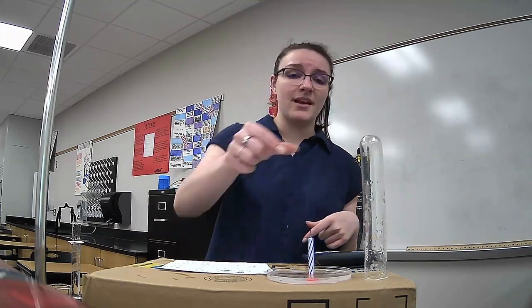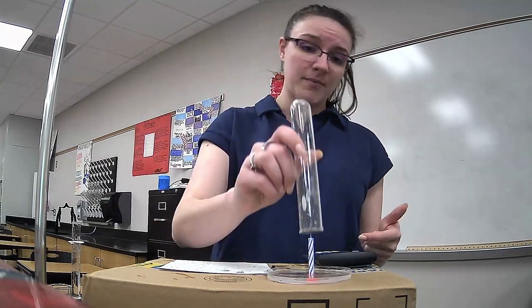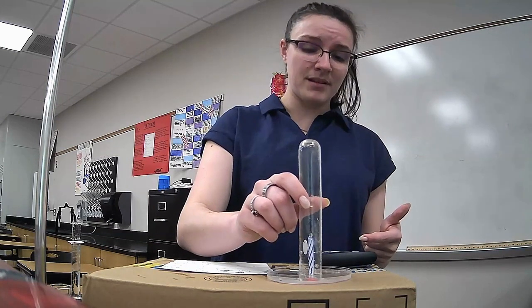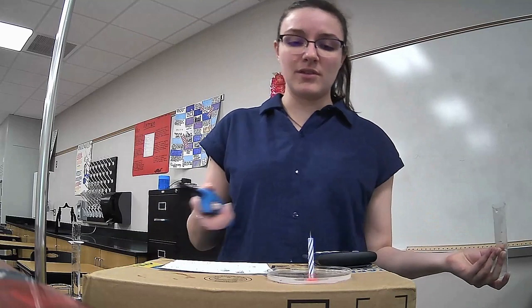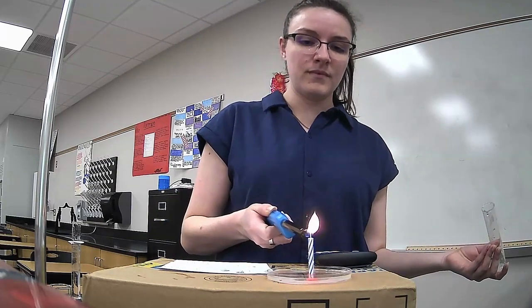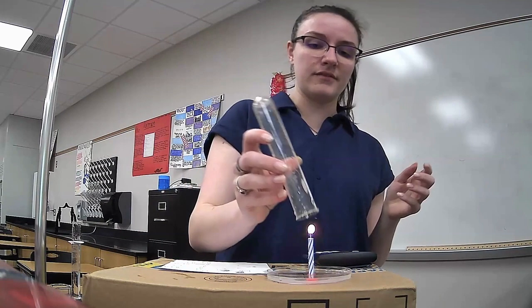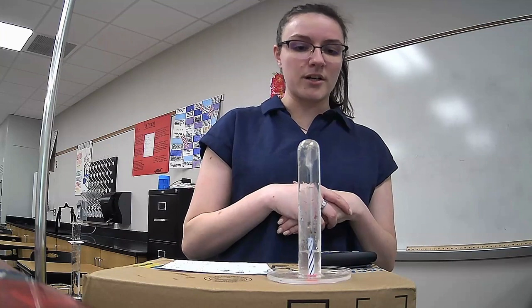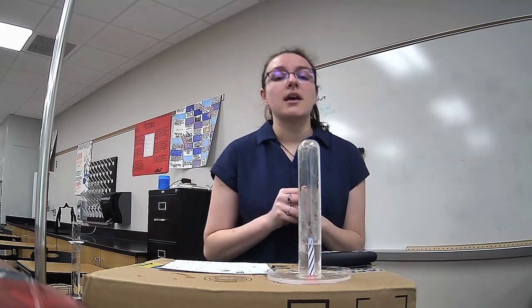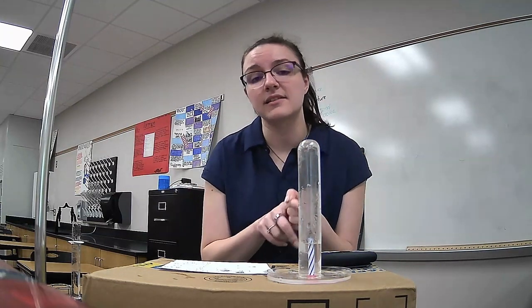There are a couple of things that can cause an error. And the first one is right in front of us, is what's happening right here. When water rises up, the candle is taking up space. So if I do this again, and again, cover and let the candle go out and the water rise. The candle is also displacing some water.